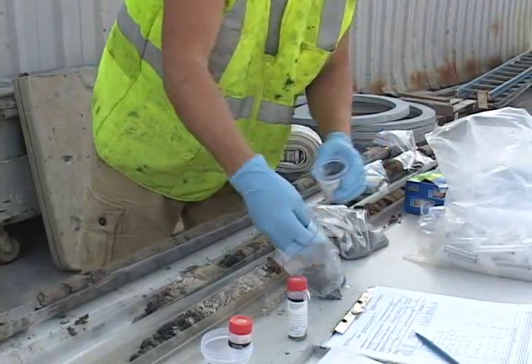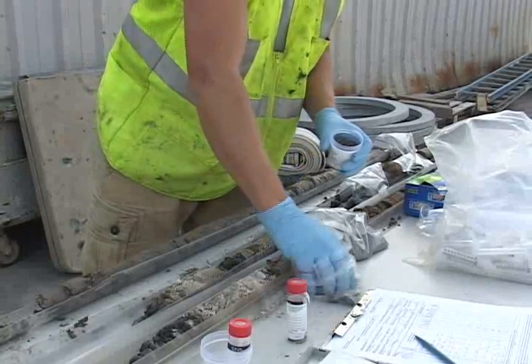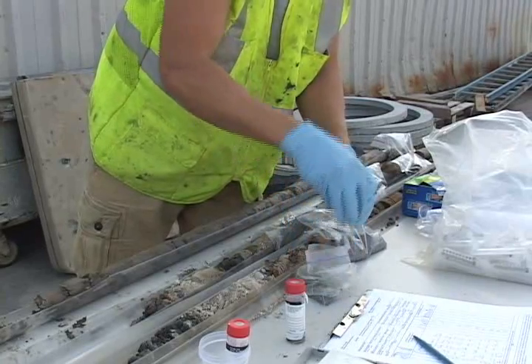You do not need to fill a full container like this. You could use a syringe and take several syringe samples and put them into the jar, so this could be done more quickly.